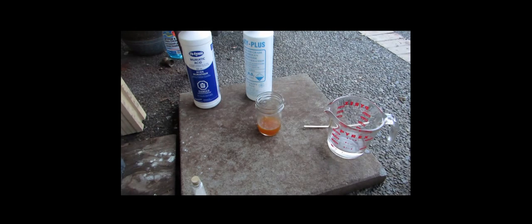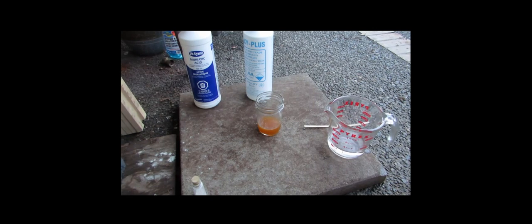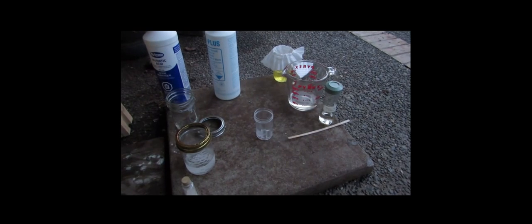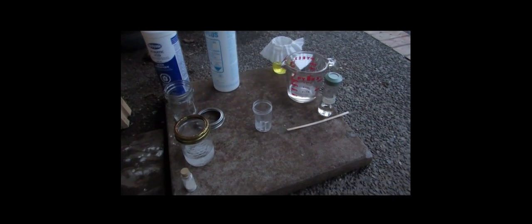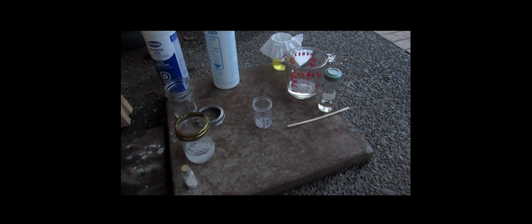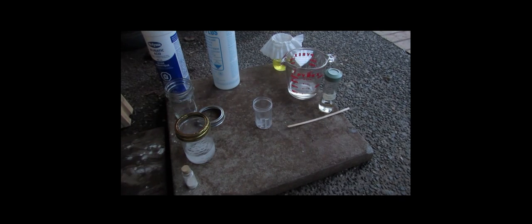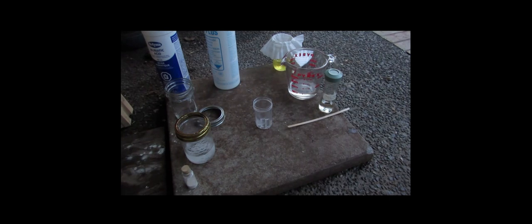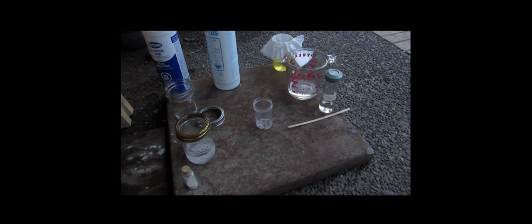I might play around with the combination of water and different stuff, but then we'll probably filter it off. Okay, well that didn't seem to actually work. It did turn bright red or something at the beginning, like brownish, which does confirm the presence of iodine. But then it went back to clear, kind of yellowish clear. So I don't think it really worked.